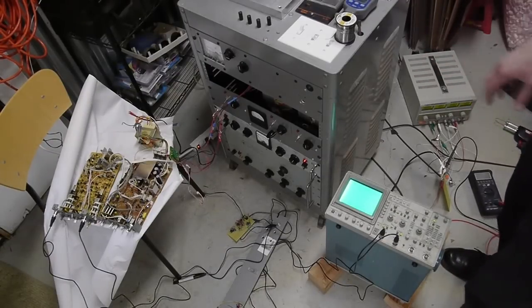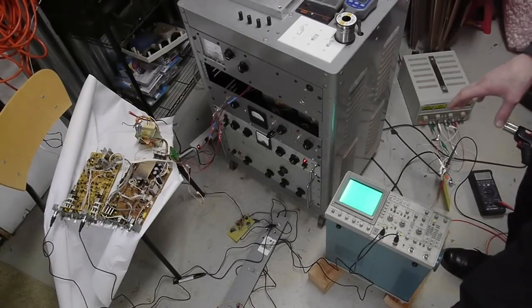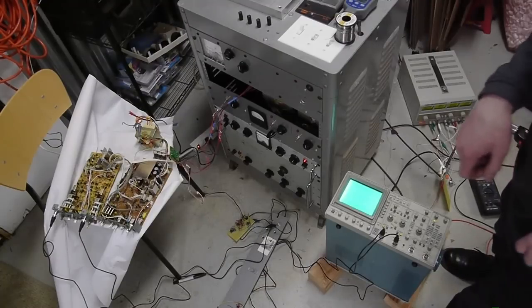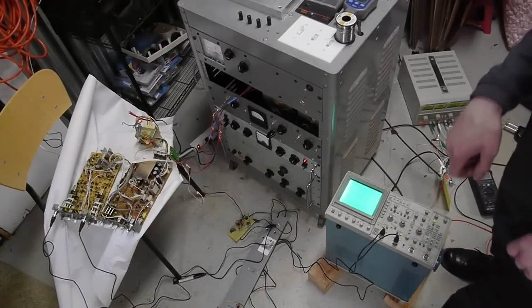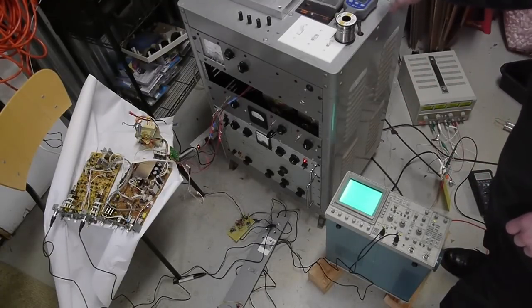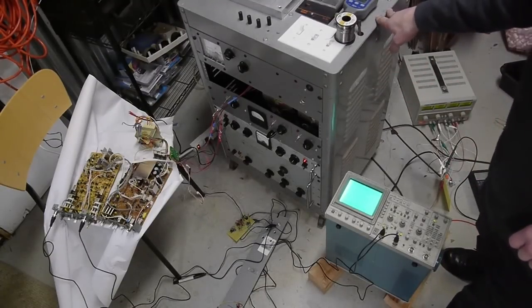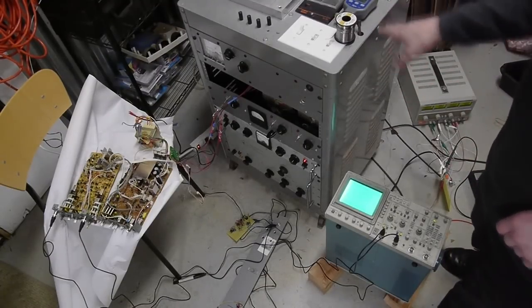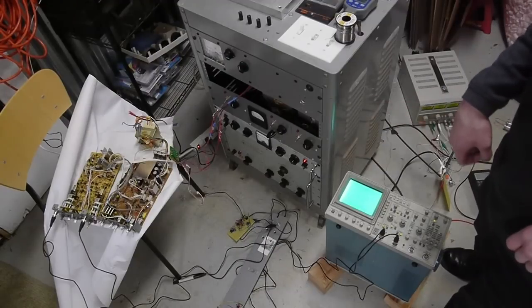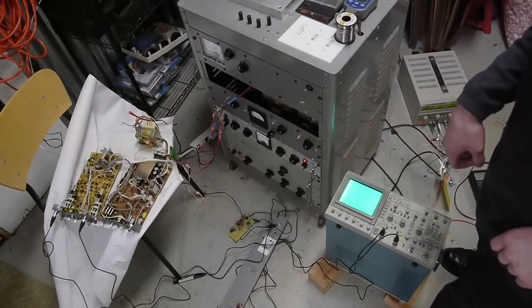It's a pretty complicated project, and you can check out the other videos for more details on the microscope. This video will just concentrate on the oscilloscope connection. I'm going to switch on the diffusion pump and fire up the microscope and show you what the image looks like on the Tektronix.